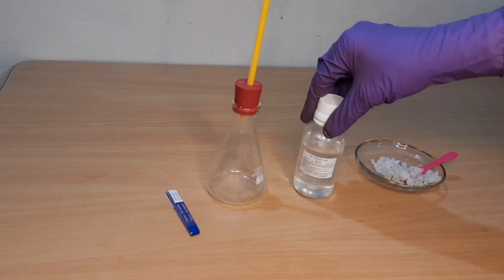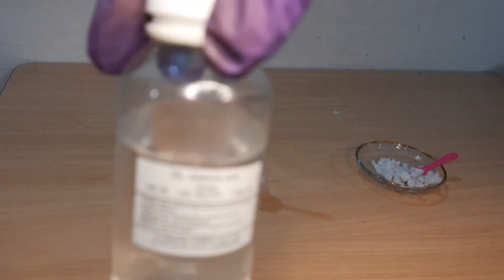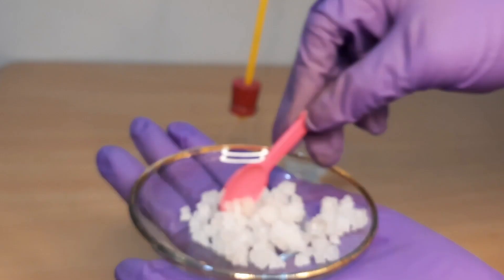Today we will do an activity to show that acids do not show acidic behavior in the absence of water. For this activity we need sulphuric acid, blue litmus paper, and salt.